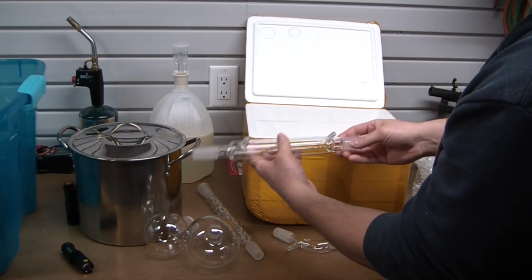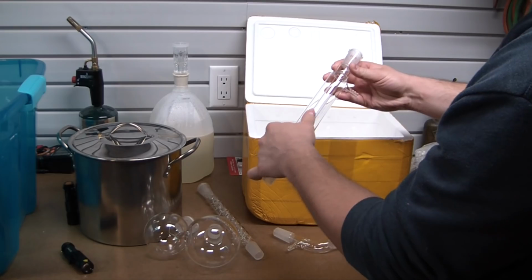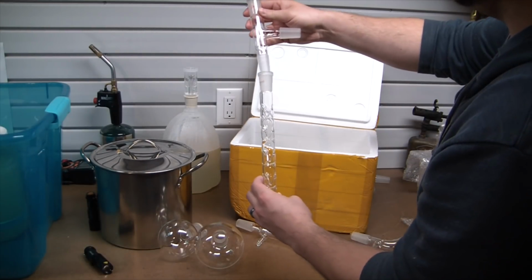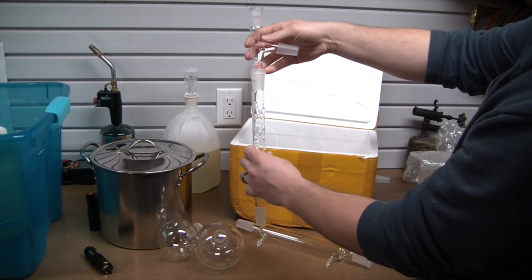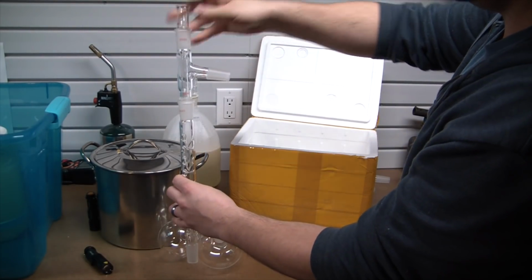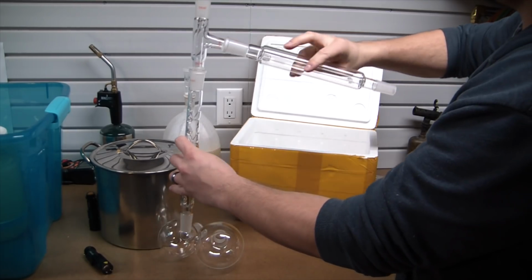Here's the condenser. So you can see, nice glass condenser. Gonna pump some chilled water through it. That'll help condense our ethanol vapors. But essentially, this is what we're gonna be setting up here. So we got our Vigreux column, adapter, thermometer well in there, and then the condenser.